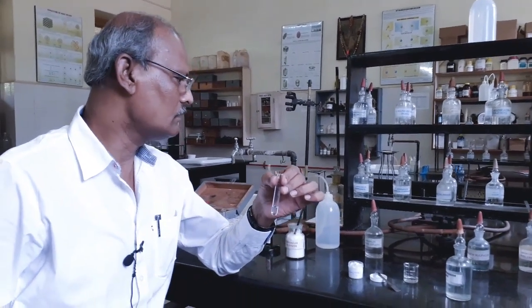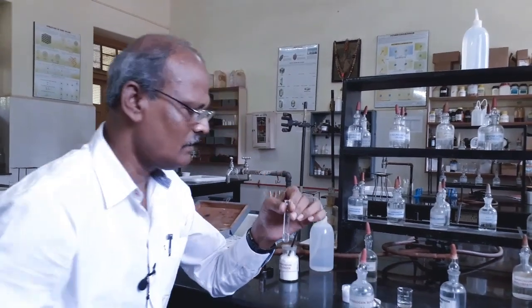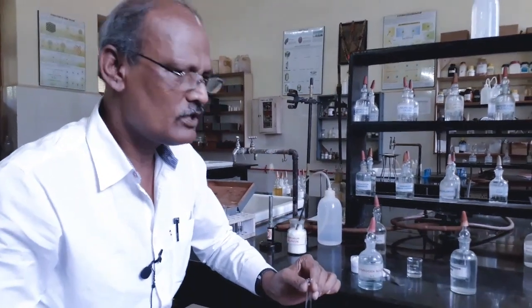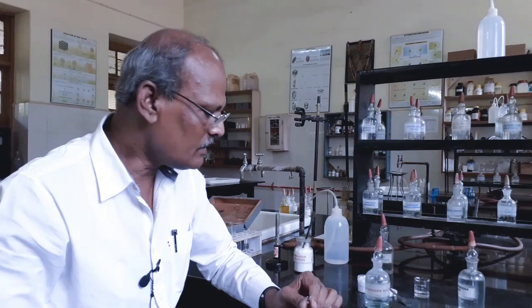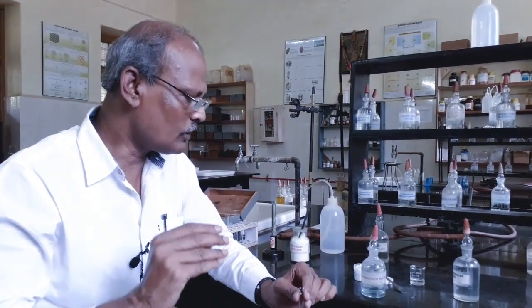Then to check the presence or absence of fourth group basic radical, we need to add hydrogen sulfide gas. Directly we are not passing hydrogen sulfide gas since it is a poisonous gas and also it has a rotten egg odor or foul odor.